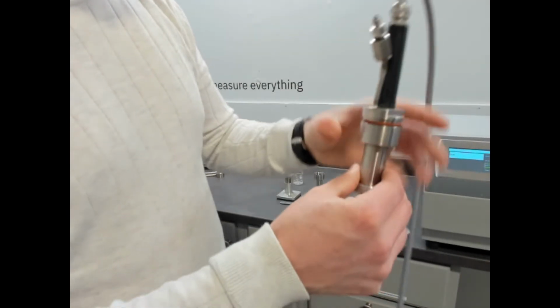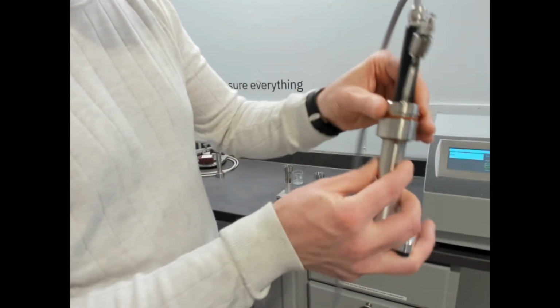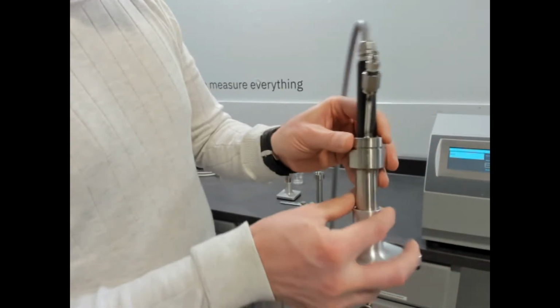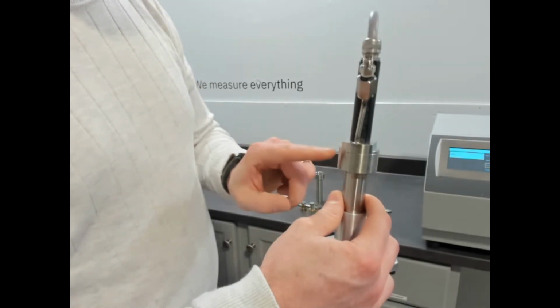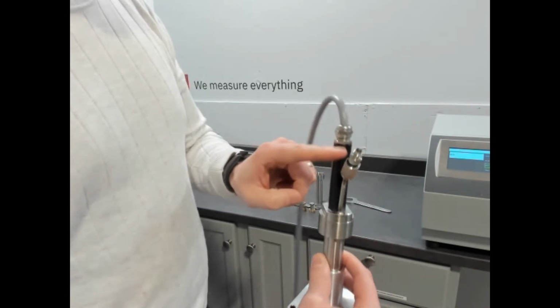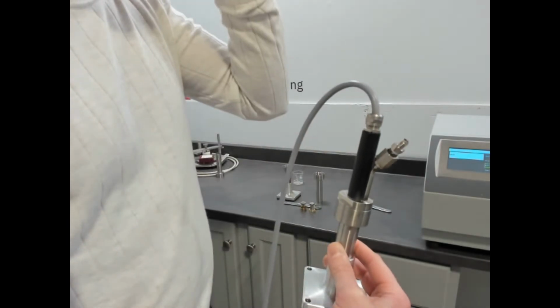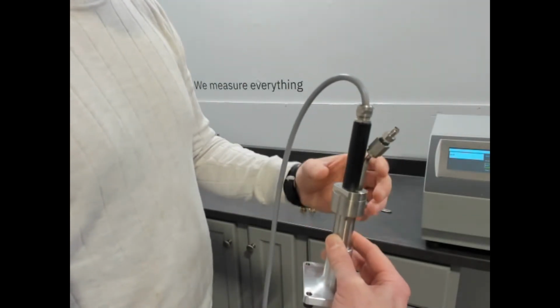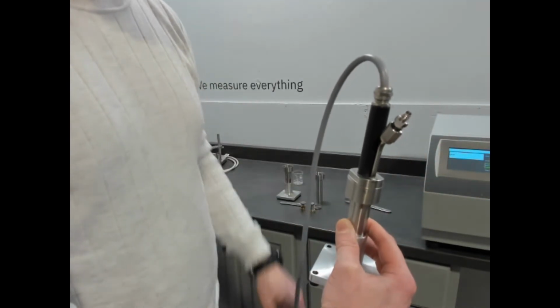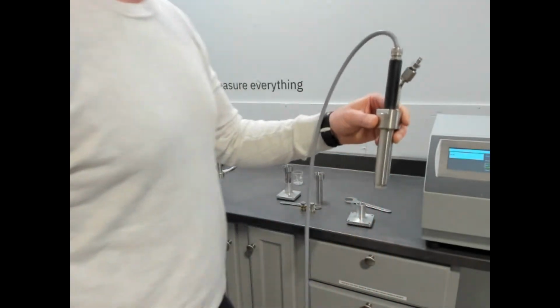If I was taking this apart, I would just do this all in reverse. So you would turn it. Of course, if I was doing this on the bench, it'd be a little easier. And you would turn it until it's sealed. And now you have, in this case, a silicone gasket sealing it. It's completely sealed. This is your back pressure line. Right now it's just open, so it's ambient. We're not applying any back pressure, but if you did have evaporation, you want to contain the pressure or add extra pressure, this is the line you would use. And now that we've loaded that cell with water, we can take the adapter off.